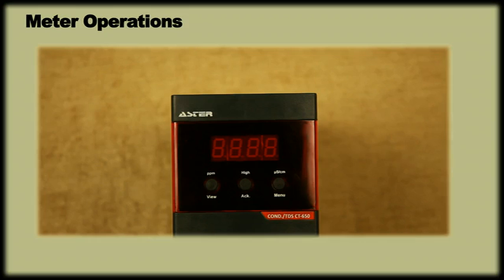Meter Operation. Let us now learn the operation of the meter. By turning the meter on, the display will show the company name, type, version and output.